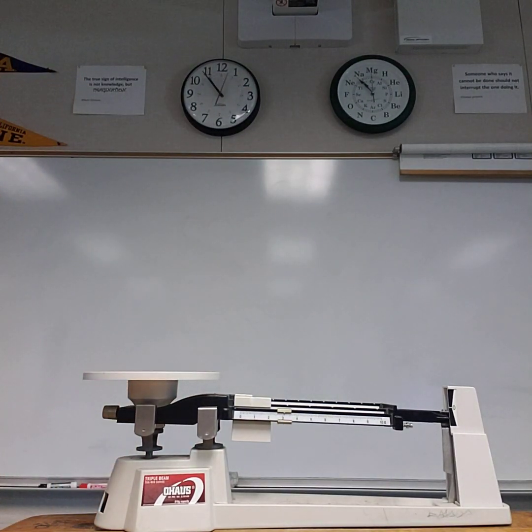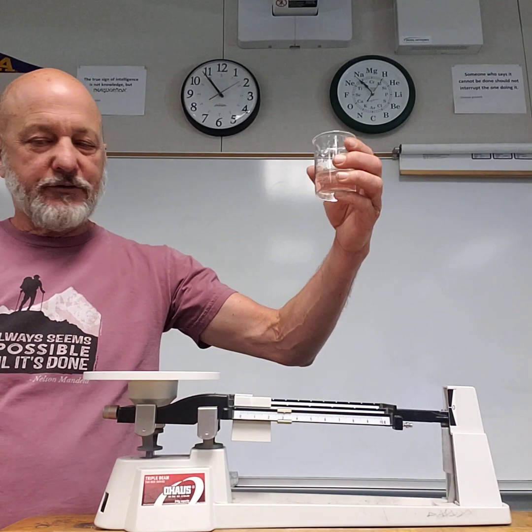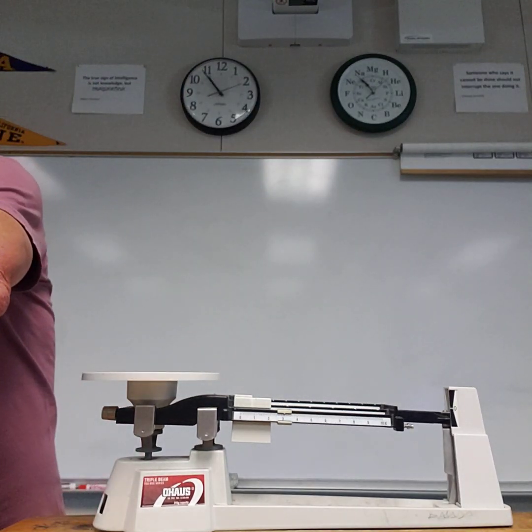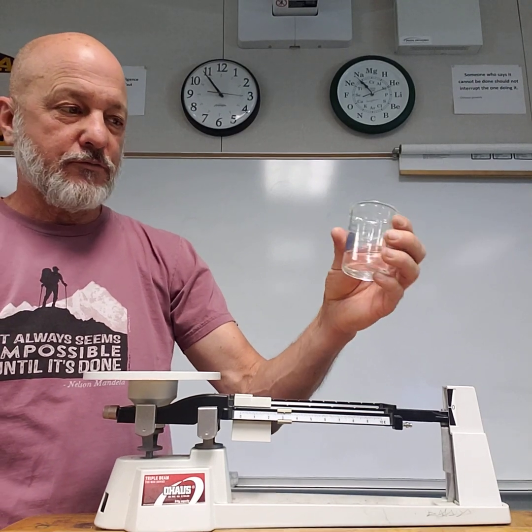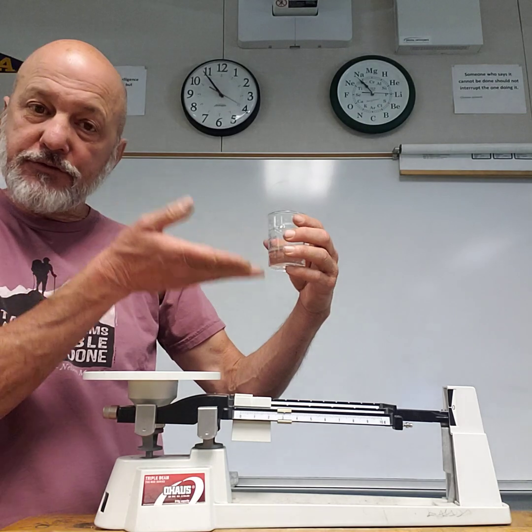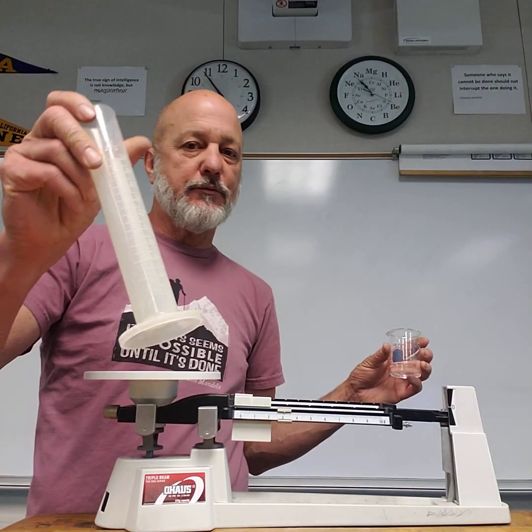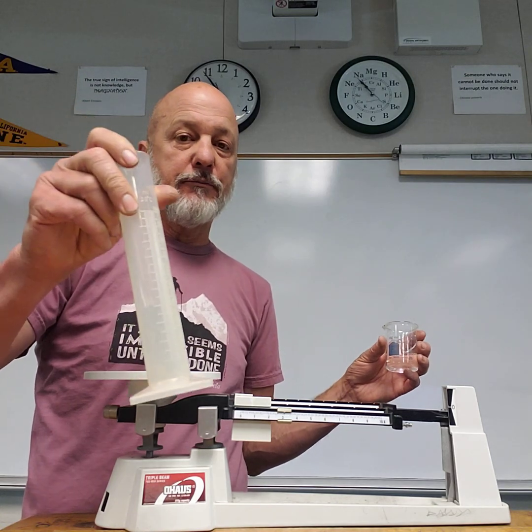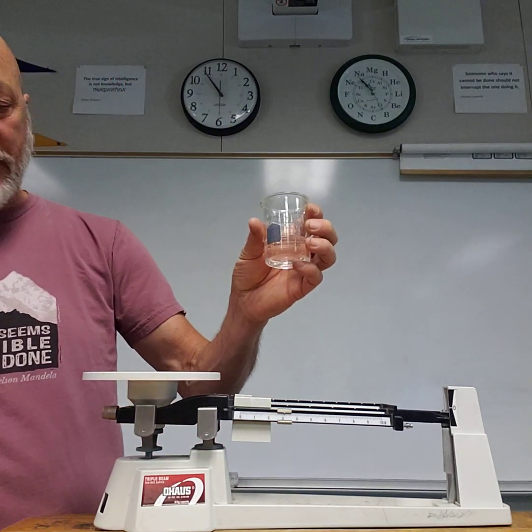So we're going to take just tap water, and notice, to point out as we get further on, I put about, this is a little too much. We're not really measuring precisely. The lines on the beaker are not used for precise measurements. If we can say, oh, add about 30 milliliters, then you can use these lines. But anything that requires any accuracy, we're going to use graduated cylinders. These are much more accurate. Beakers are just for estimating volume.